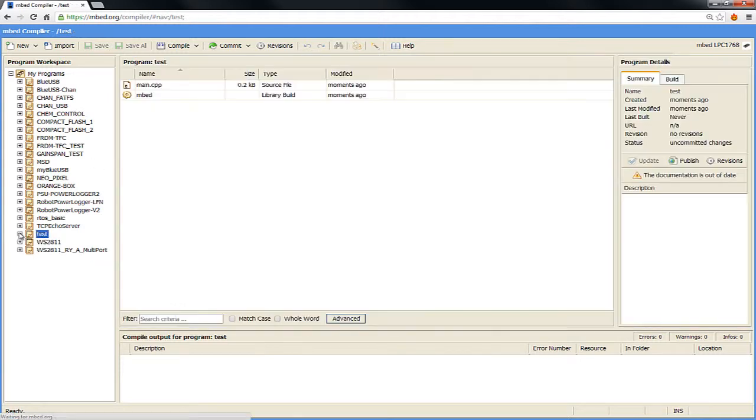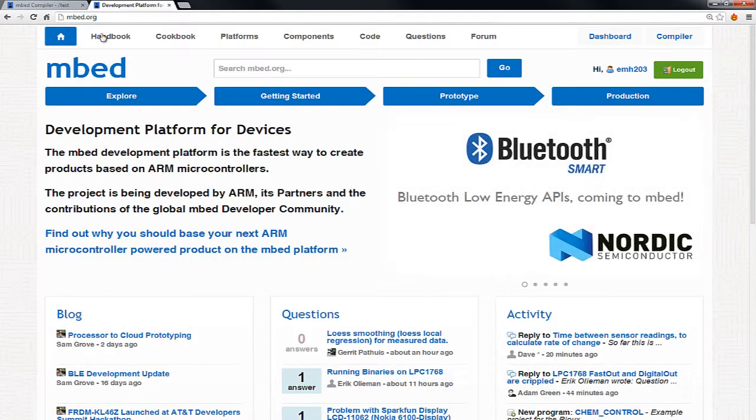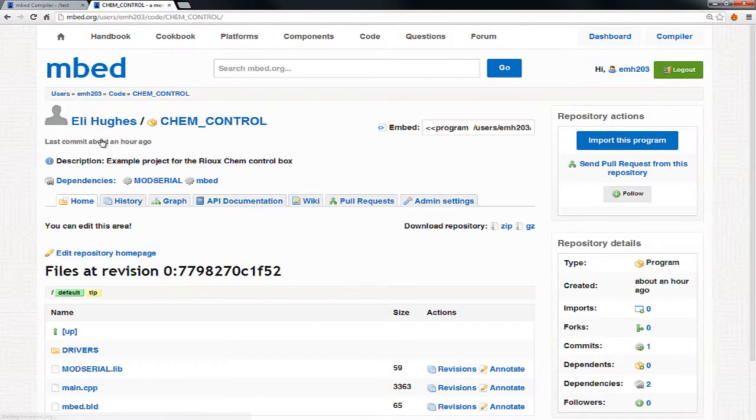So what I'm going to do is I've already published this program. So I'm going to go to mbed.org, and I'm just going to type in ChemBox. And you'll see Eli Hughes, that's me. This is kind of like the page that it generates for example projects. So as I make, say, fixes, or you make fixes, you can push them to here. And I'll have more data on this web page as it goes along.